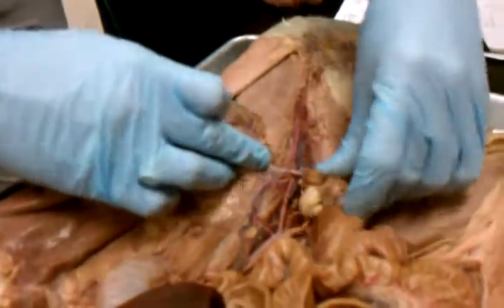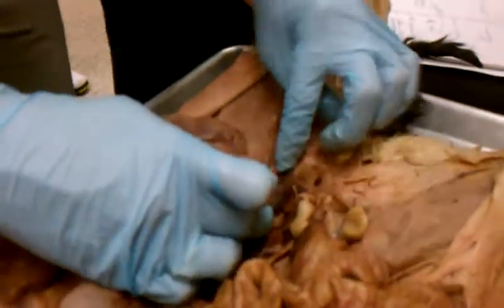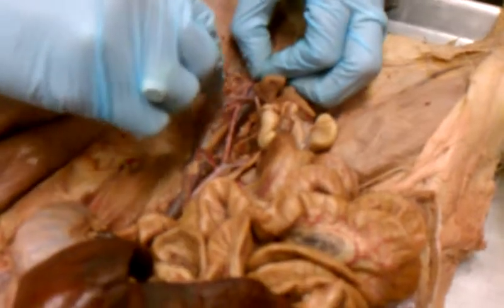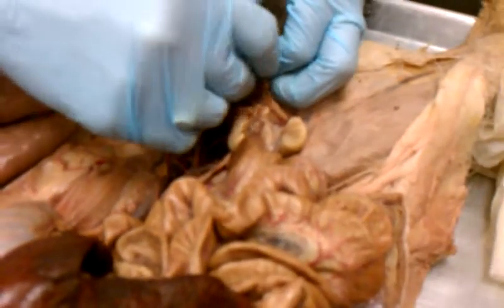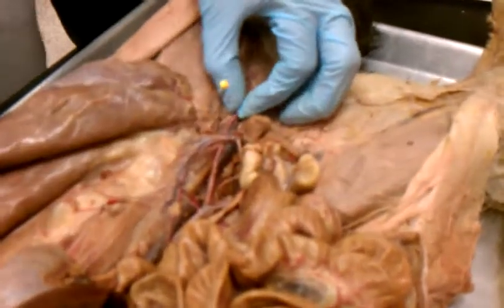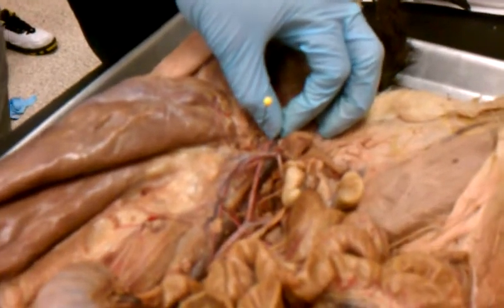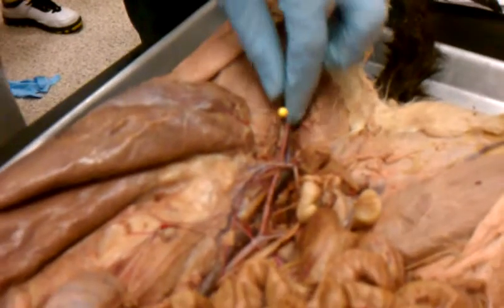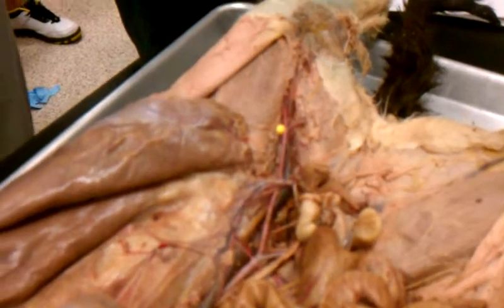Where it goes deep into the leg, it's the internal iliac. So on this cat, it's right there. Unless I can really see that, I won't ask it to y'all. But if I can pull it, like I can actually pull this out and you can see where it goes deep into it, then that's fair game. Does that make sense to everyone? And what is that again? That's the internal iliac where it goes in.